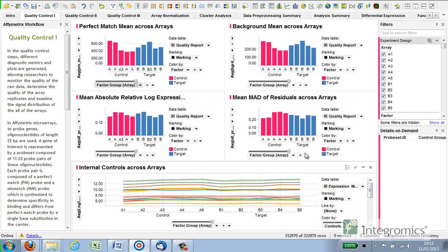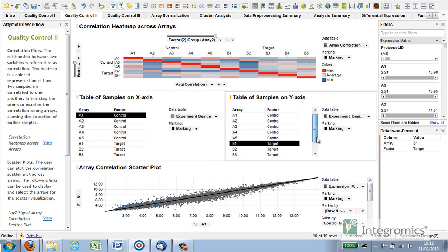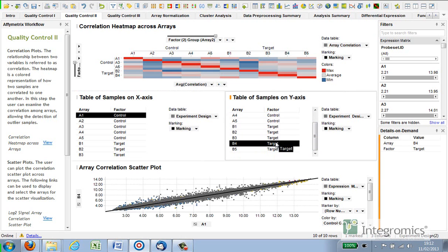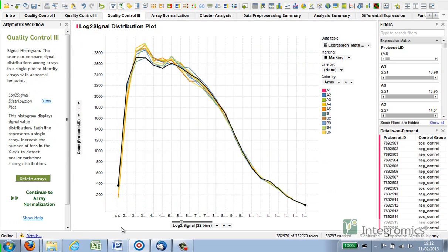across the arrays. The correlation plots represent the second tier of QC that IBD offers. The ability to assess the correlation between different samples allows us to determine the prospect of outliers amongst the biological replicates within the groups. By specifying on the table of samples, it is easy to go through and assess the correlation between individual samples. The signal intensity of the arrays can be observed in the QC tab as well.